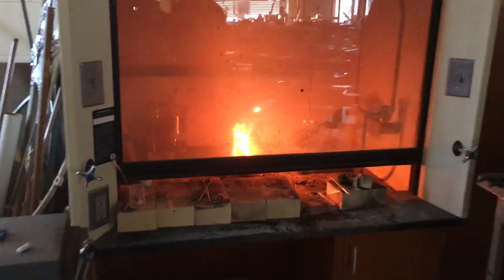All right, so that is copper oxide and aluminum thermite.